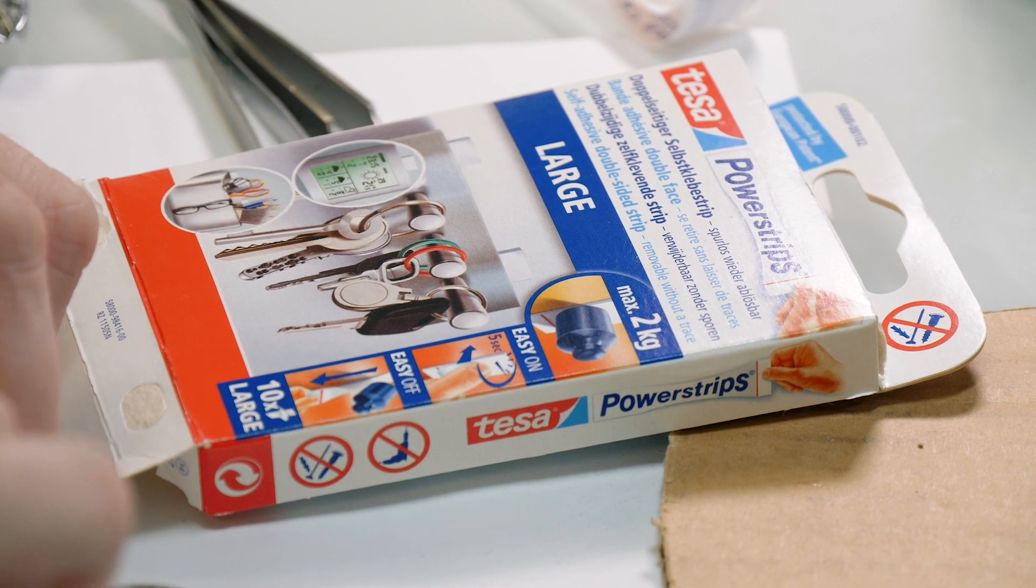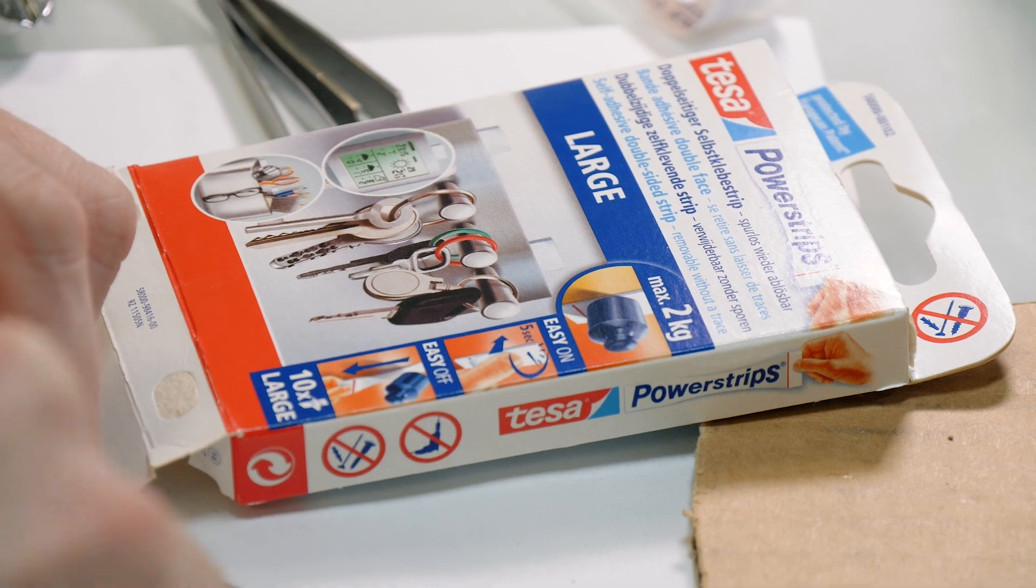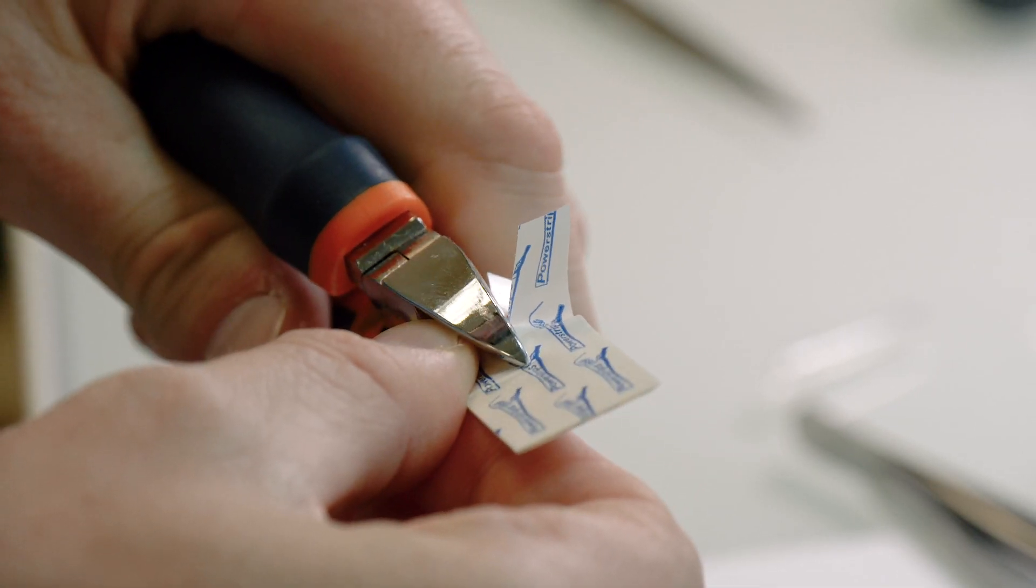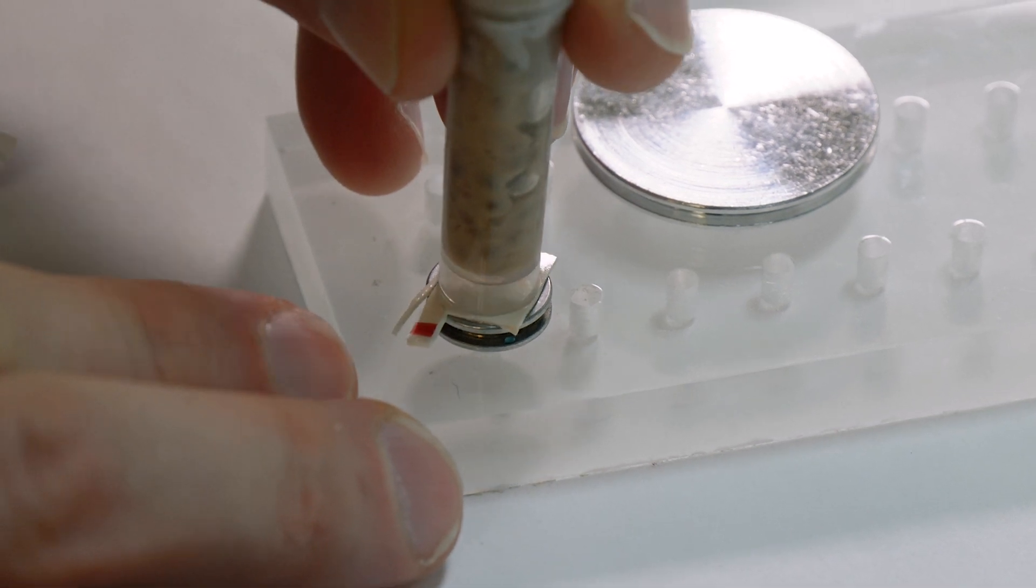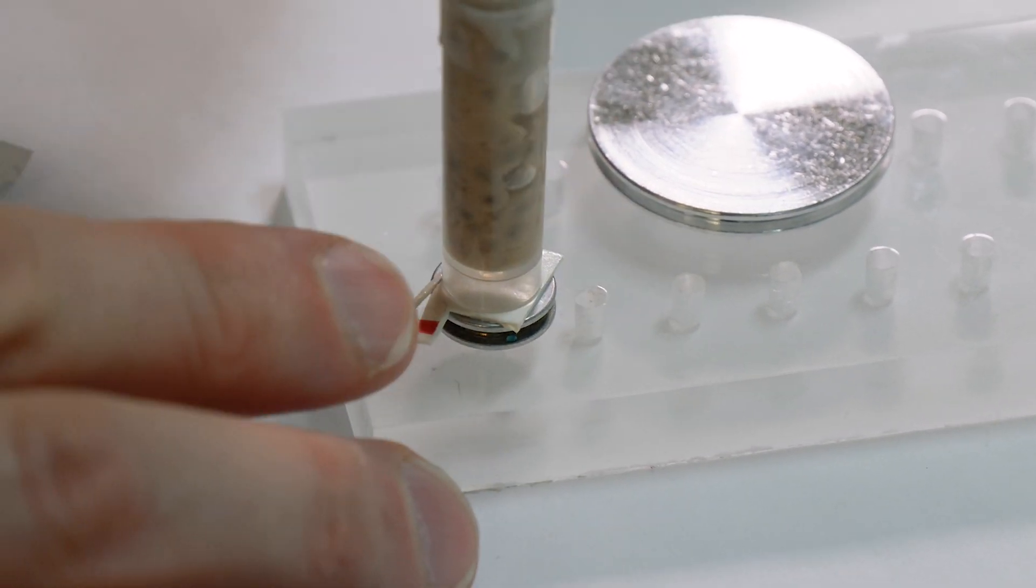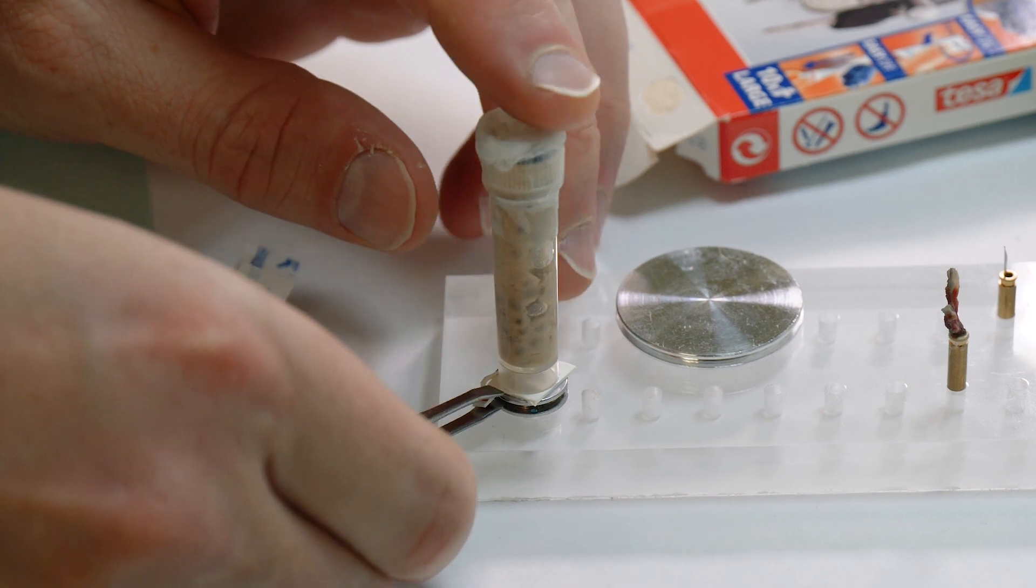Use adhesive strips like this if you need to remove the sample easily. You can simply pull them off after use.